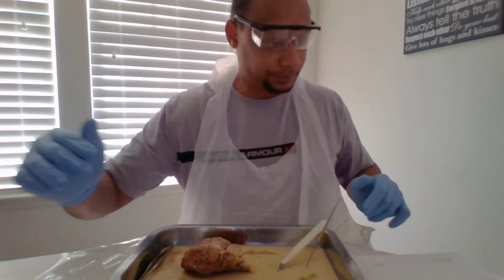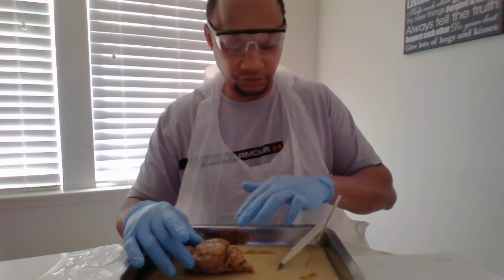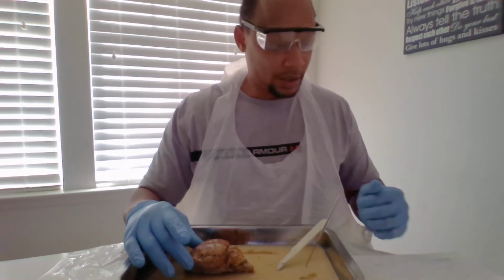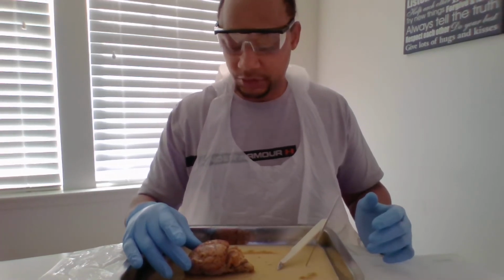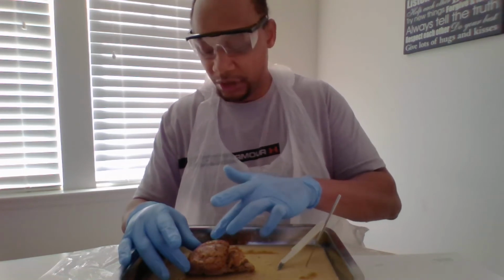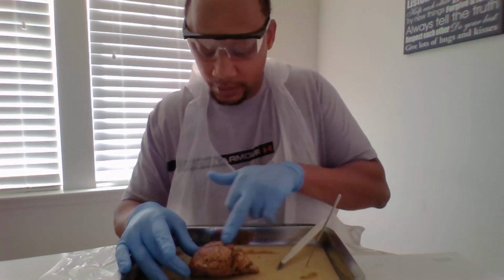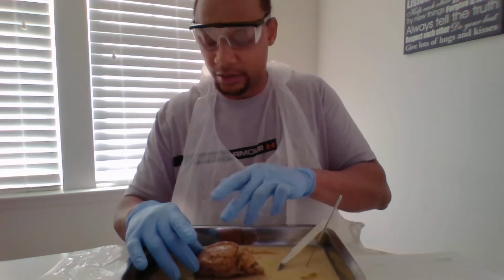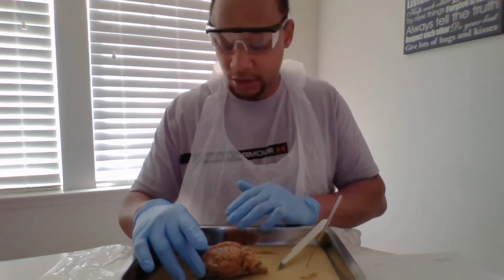First, we go over the sections, which are the cerebrum, cerebellum, and spinal cord. First, we'll be going over the cerebrum. You have the longitudinal cerebral fissure, which is this line that normally goes down the middle right here that separates the right and left cerebral hemispheres.